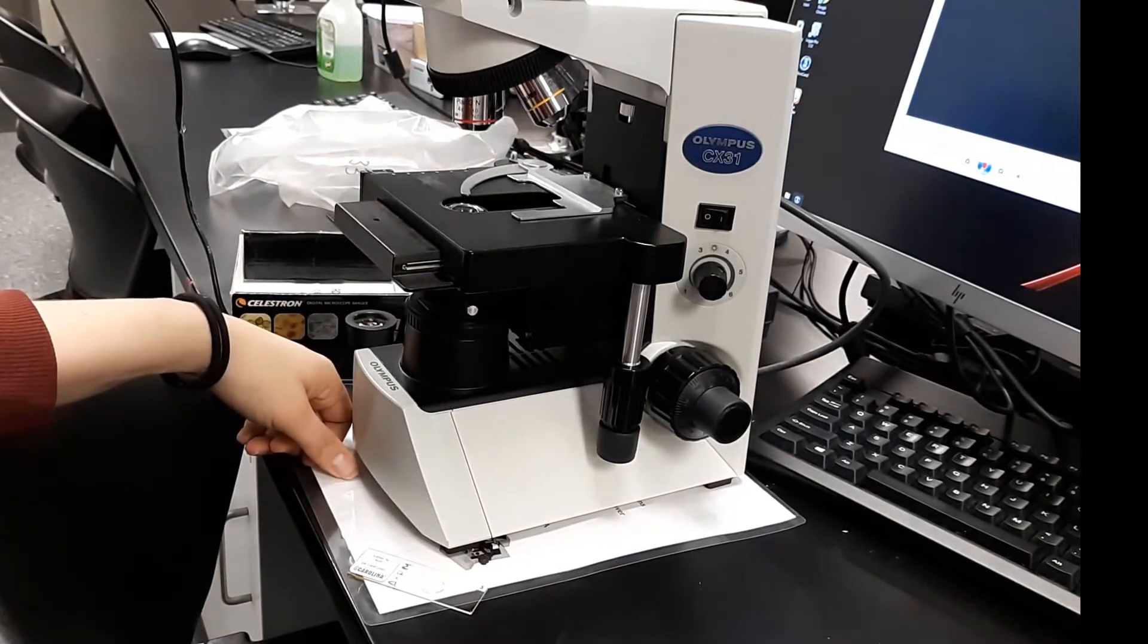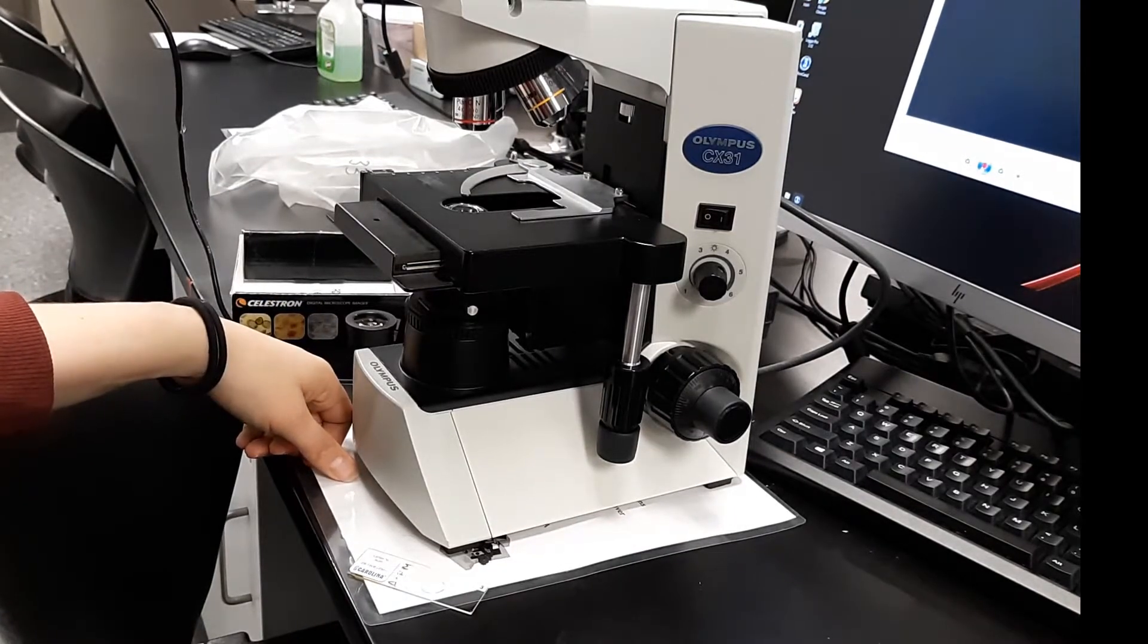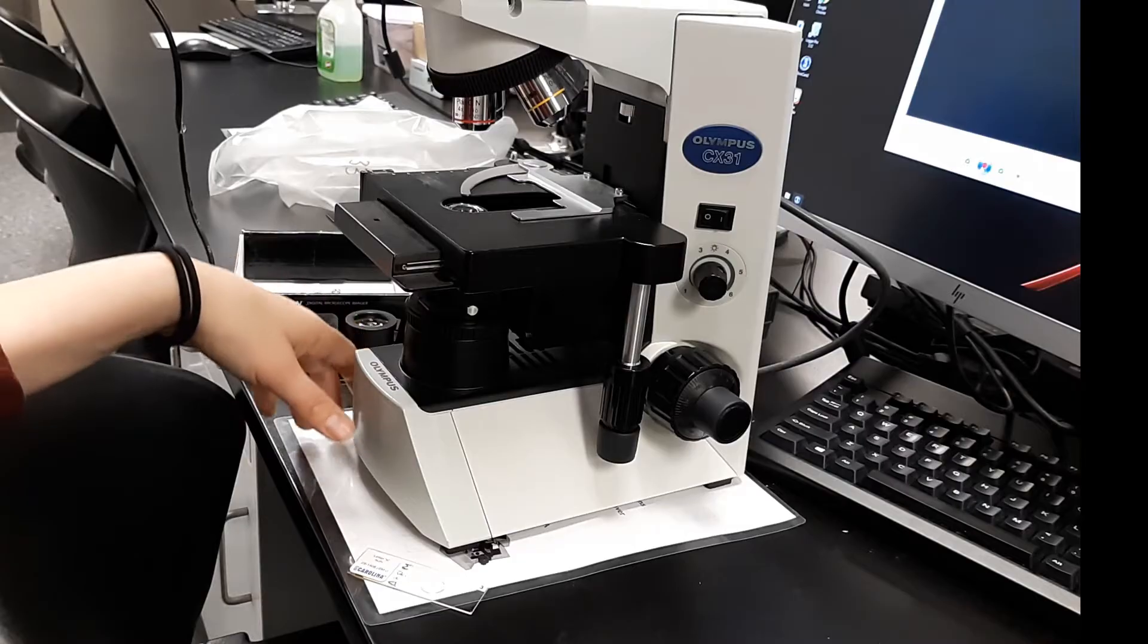In this video, we're learning how to use an Olympus microscope. The first thing you're going to do is make sure it's plugged in.